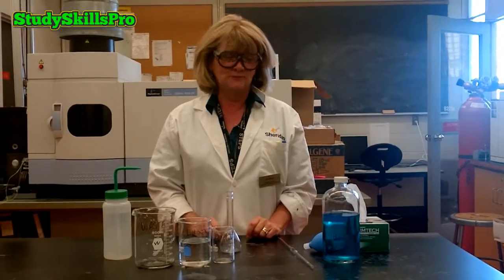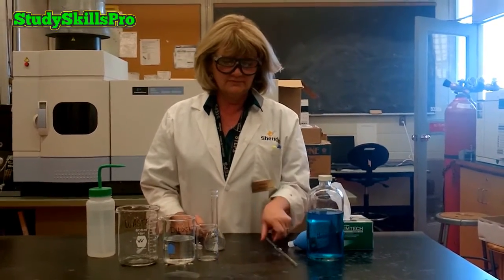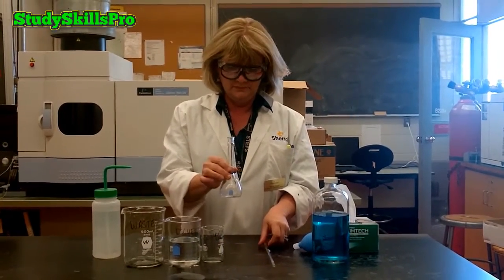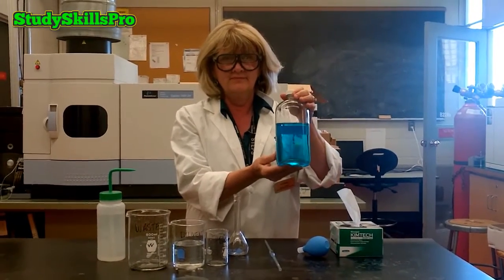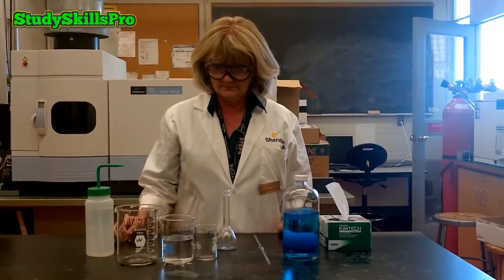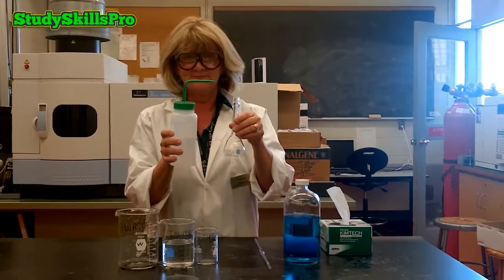Today we are going to demonstrate the correct analytical technique for pipetting using volumetric glassware. To demonstrate this, we are going to prepare a substock solution in a 100 ml volumetric flask using a stock solution of blue copper. Our first step is always to analytically rinse our volumetric glassware. We will begin with analytically rinsing our volumetric flask.